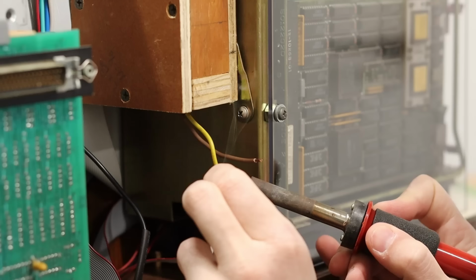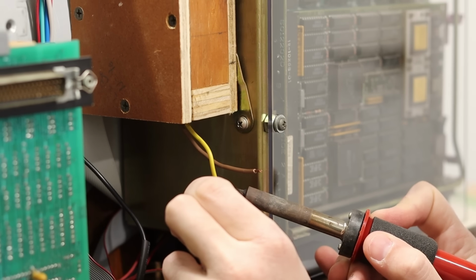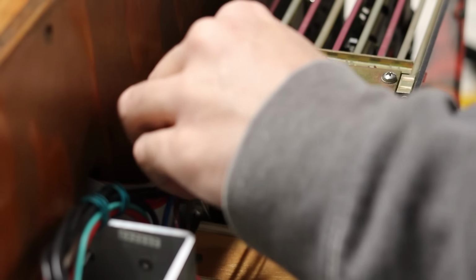Next, I'll start soldering up the power wires. I need to get mains AC up to the wall wart box and make sure that all the grounds are in the right place for negative voltage.